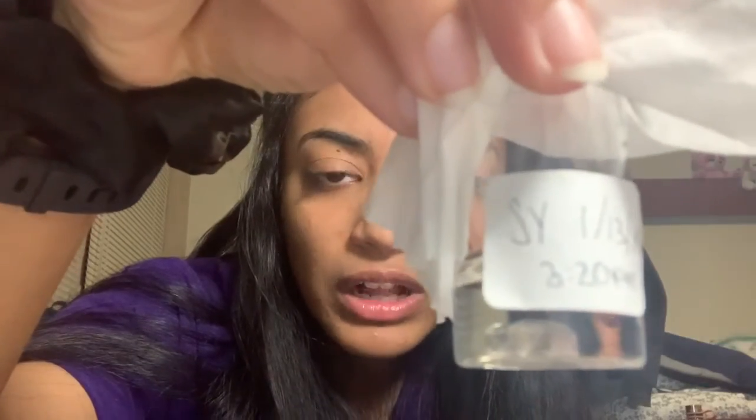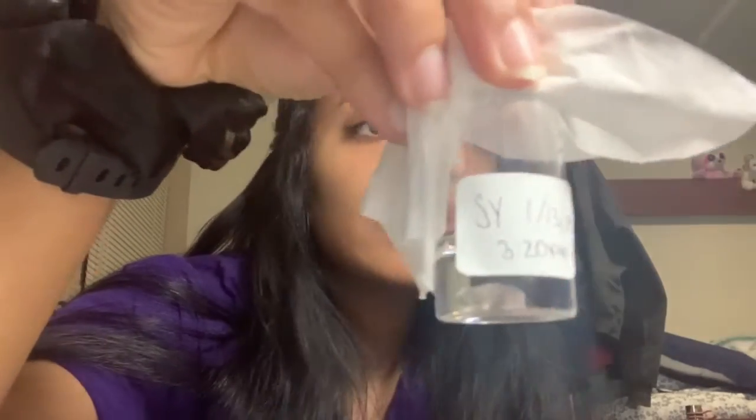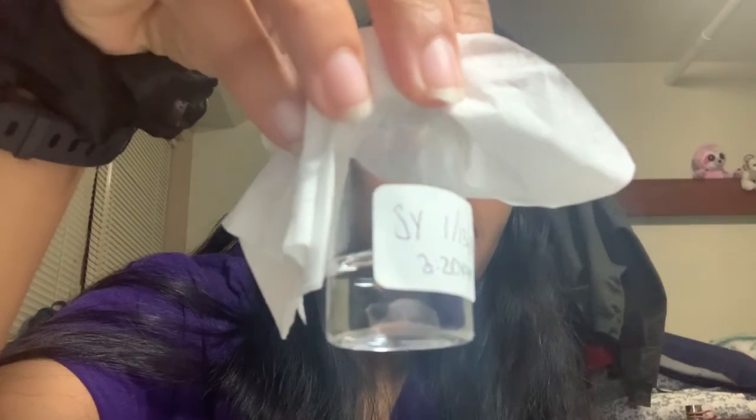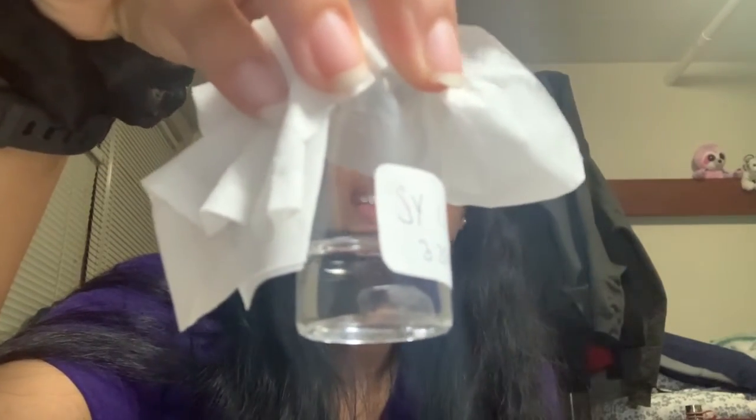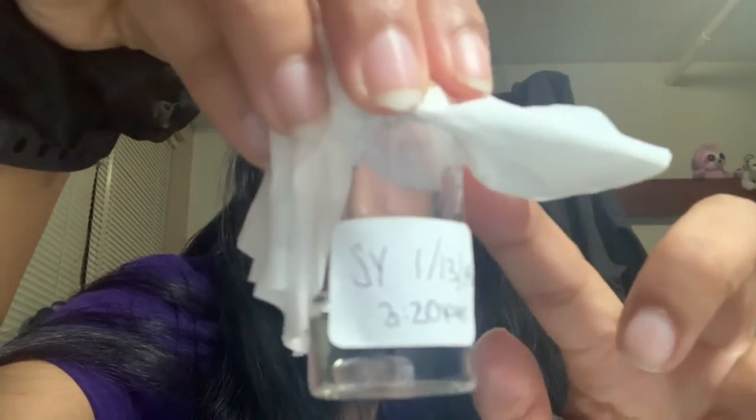In my second video, I still had no crystals, but there's a significant decrease in the amount of solution in the vial, proving that the solution was steadily evaporating. Since then, there's clearly been some crystal growth. I have exactly one well-sized crystal chunk in my vial, and the solution has also been evaporating at a steady rate, as it is now about halfway to the label, whereas before it started around up here or so.